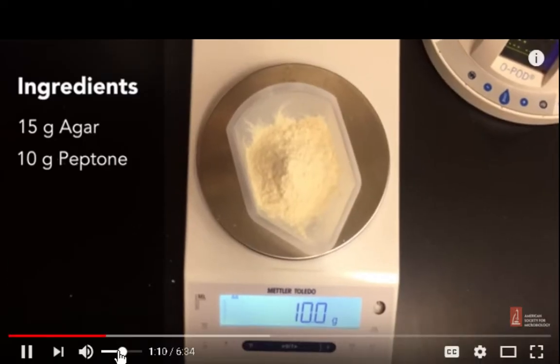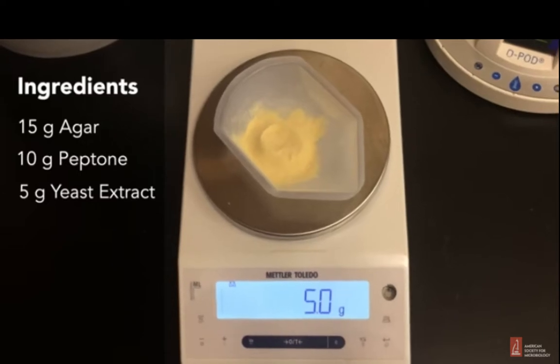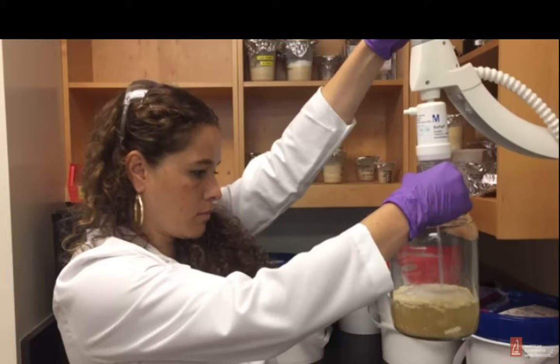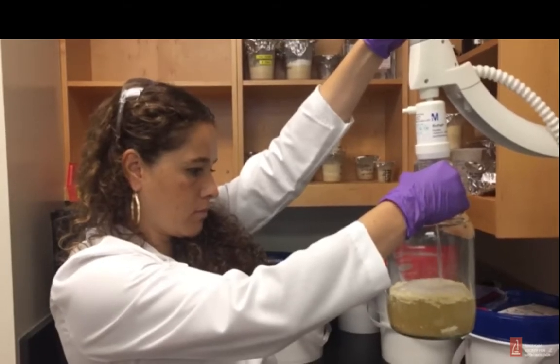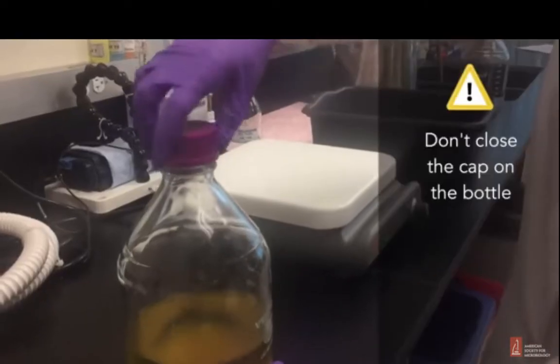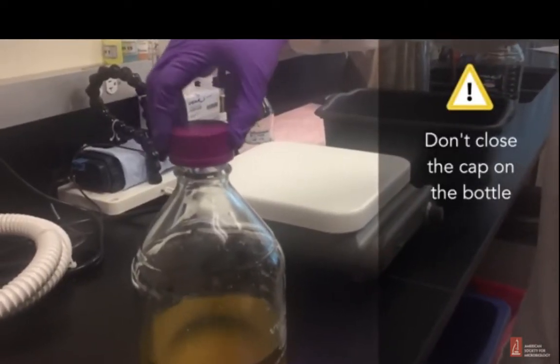10 grams of peptone, 5 grams of yeast extract, and 5 grams of sodium chloride. Oh, they're adding the yeast extract. So that's up to 1 liter of water, and make sure the bottle is not full all the way to the top. And make sure the cap is loose to allow hot air to escape.